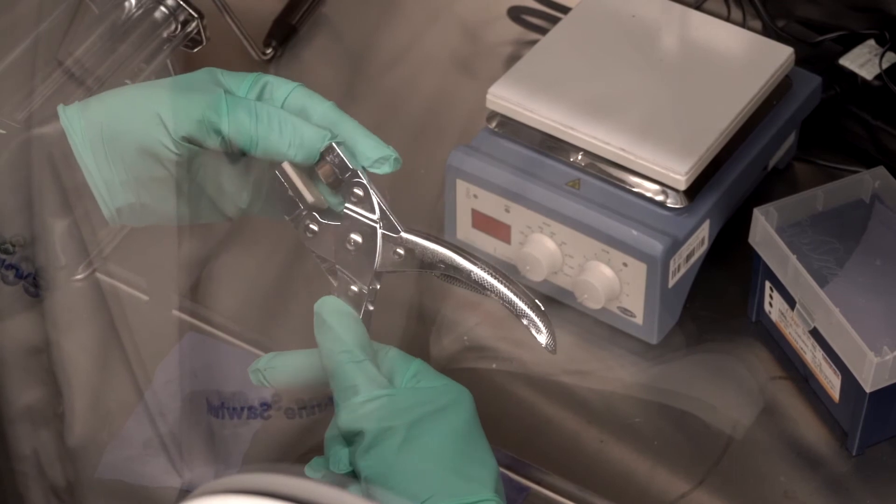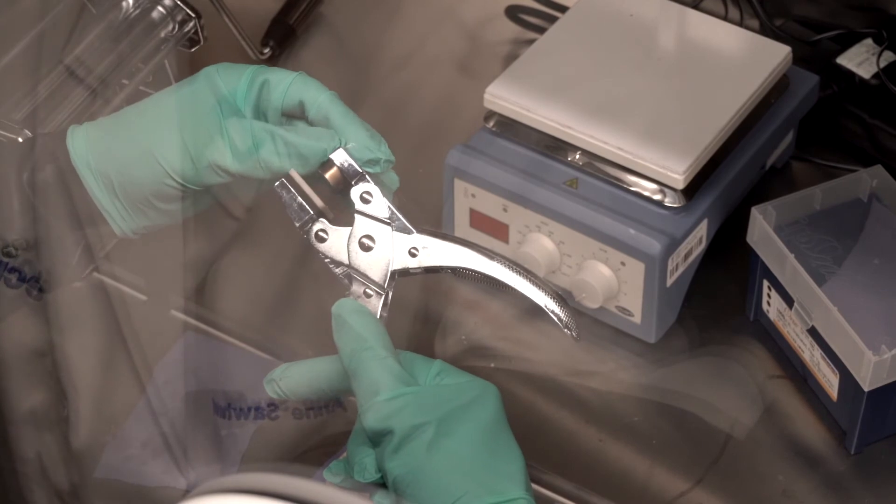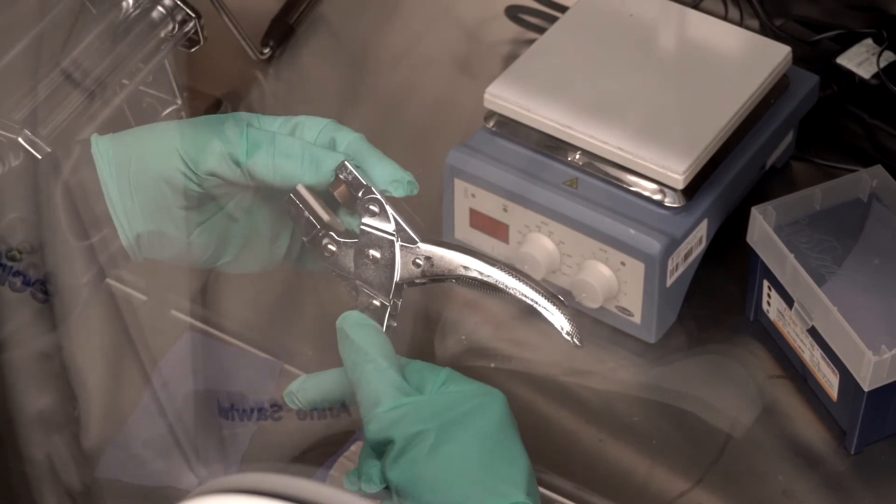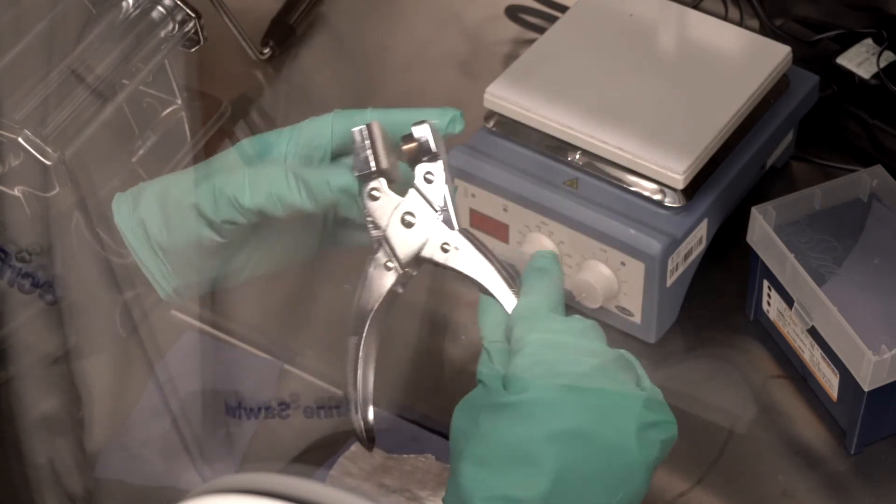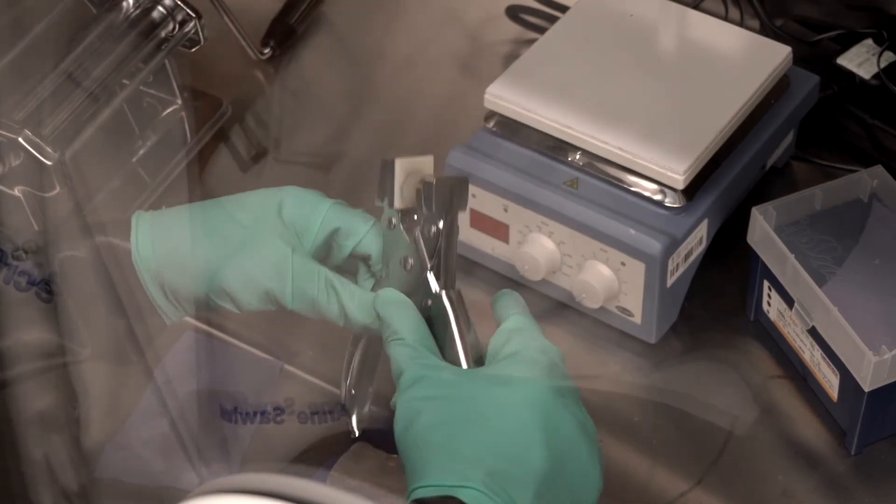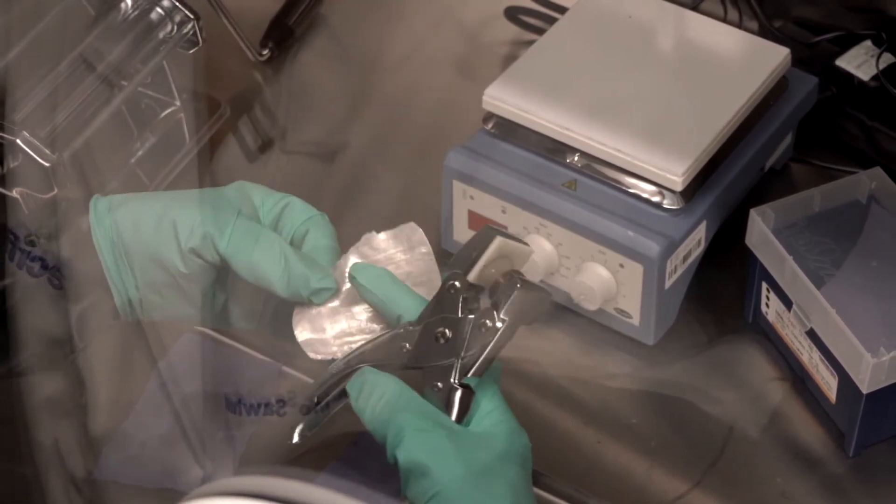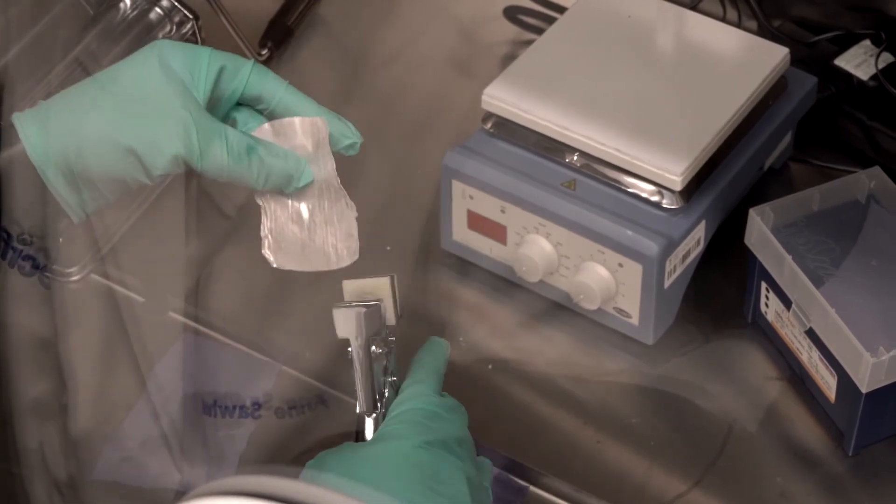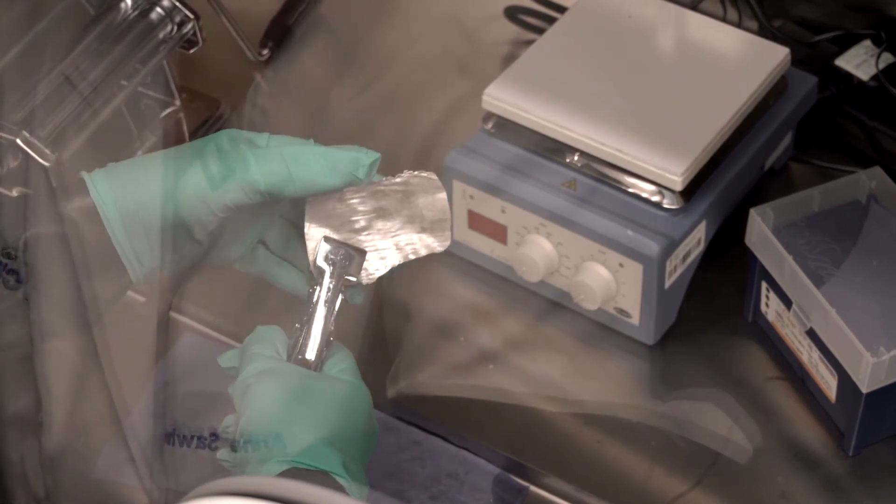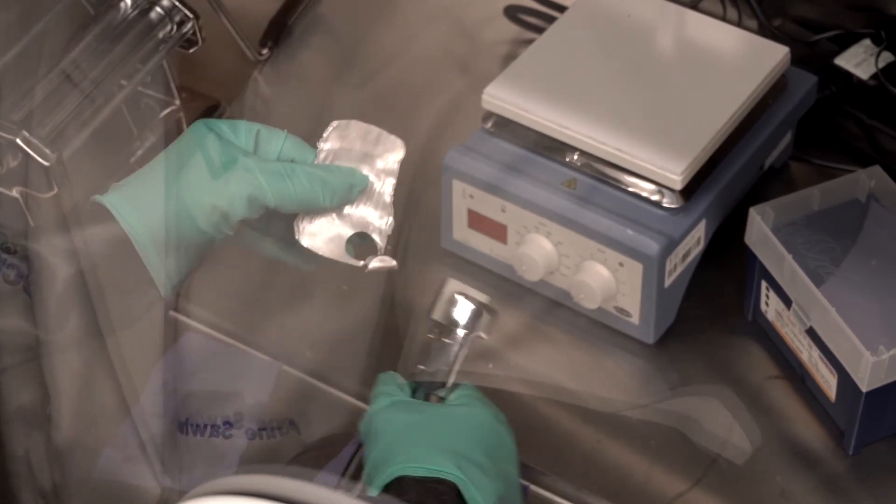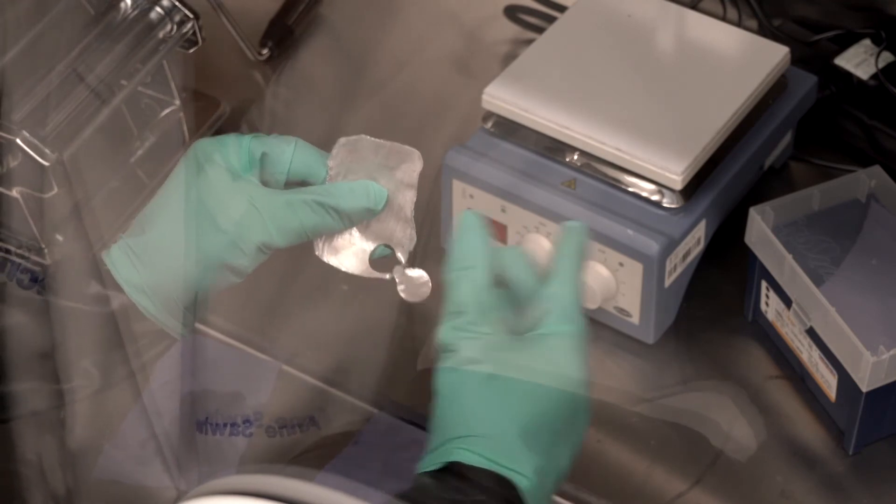My reusable cell takes 18 millimeter discs, which doesn't fit that great on this magnetic holder. So I need to make sure it's centered so that I get a proper cut. The good news is the sodium metal is quite forgiving. So I can quite easily cut without any paper or other items to assist. And you'll see I didn't even get a proper cut there.